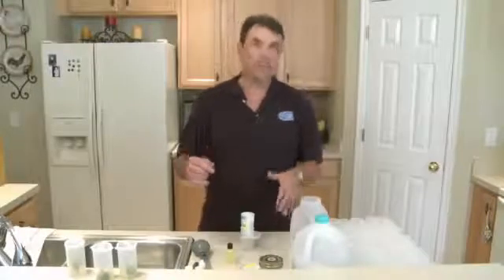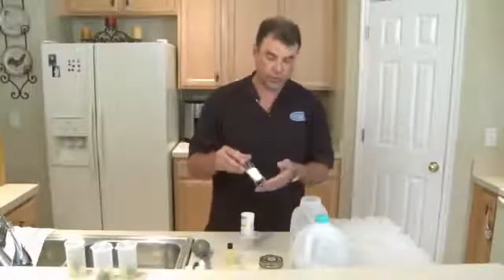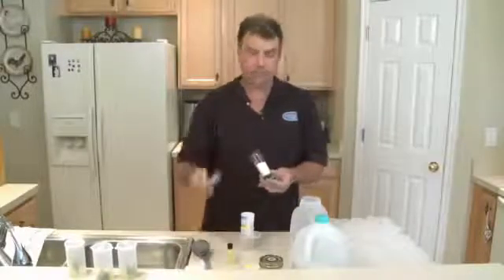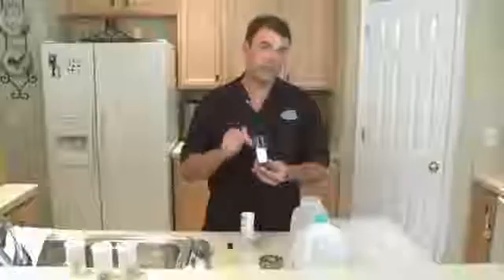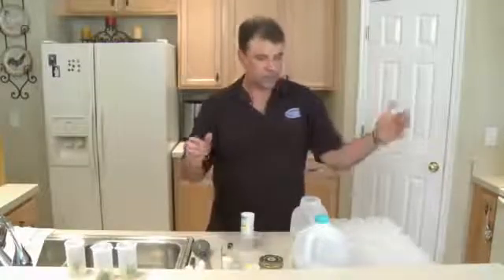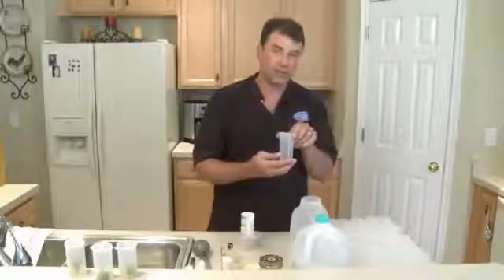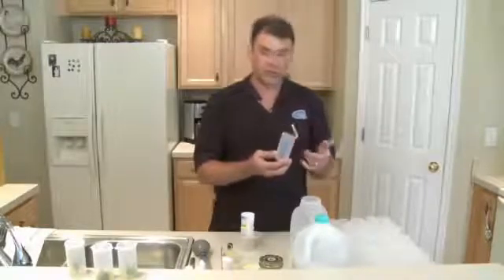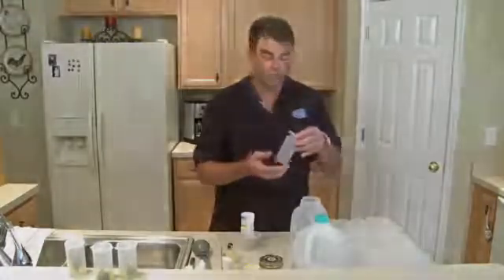Those were all included in the kit. You're still going to need sugar from your house, and that is just as simple as ordinary white sugar — two tablespoons. This is going to be about 30 grams of sugar, which in one liter will give us 50 of these special two-ounce microclone vessels. These are the exclusive vessels of microclone and are fantastic for microclone culture and tissue culture.